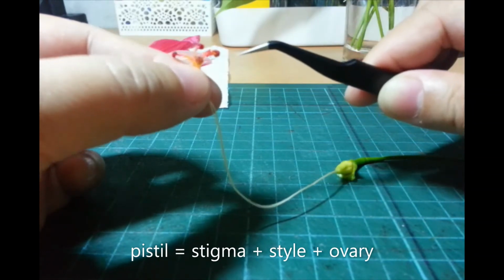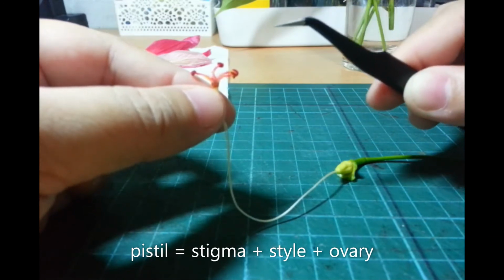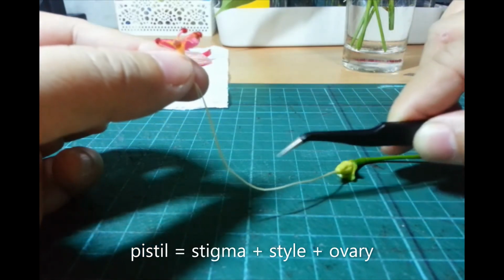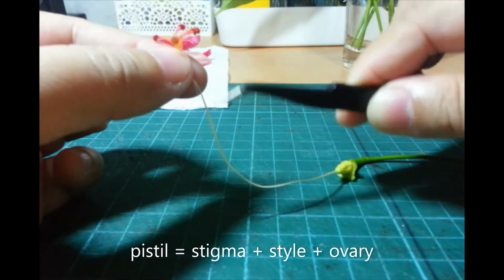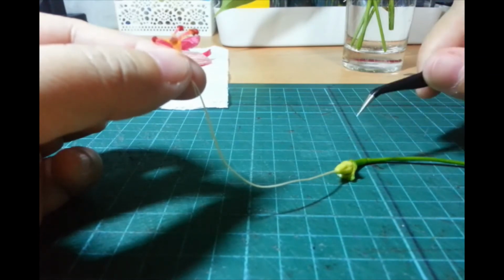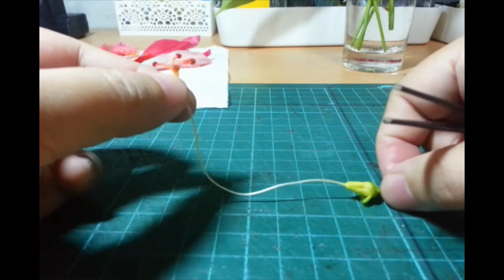Sa female, it's called the pistil. Or in some books, I think it's called the carpel. Okay? So, the pistil is made up of the stigma, which receives the pollen. So, the style is like the tunnel or the stalk that the sperm will travel through. And then, there's the ovary here at the bottom. Okay? This bulbous structure here. Okay. Nakasunod, that's the female part.